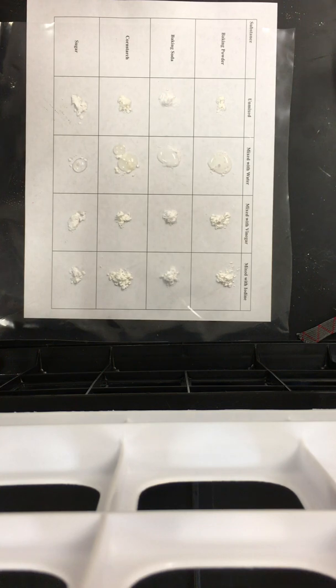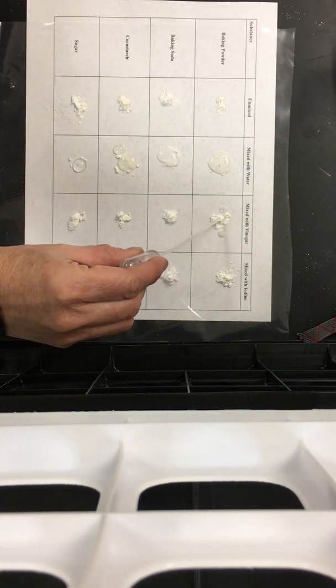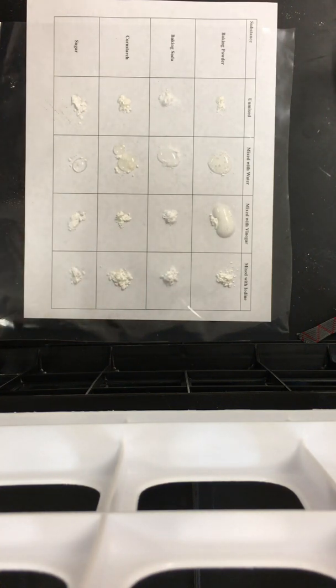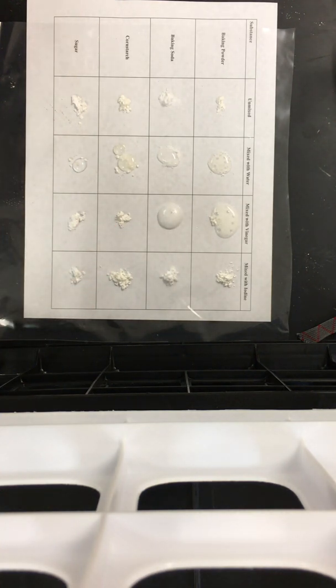So that was water. Now we're going to go down the second column. The second column is mixing with vinegar. When I mix vinegar with baking powder, you need to see that there's fizzing and bubbles, a lot more than what we had with the water. And you can even hear it. And then when I mix the vinegar with the baking soda, you get an even more vigorous reaction. It's louder, there's more bubbles, and it's fizzing.